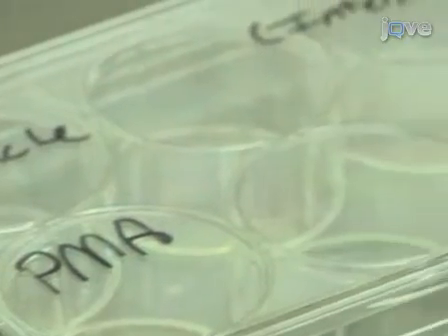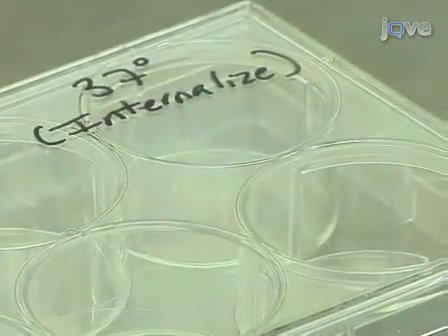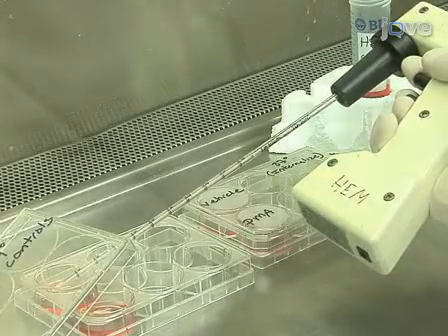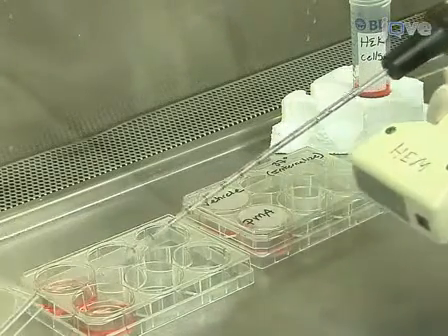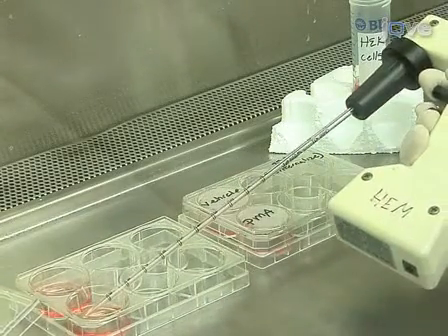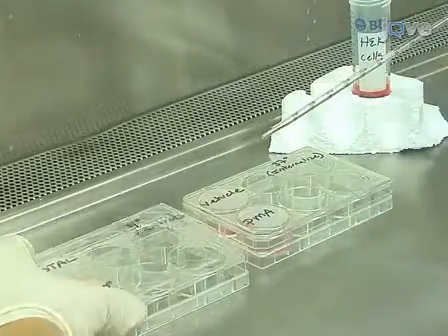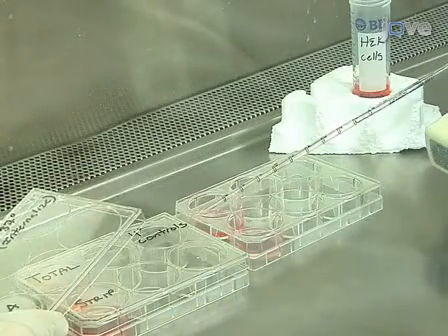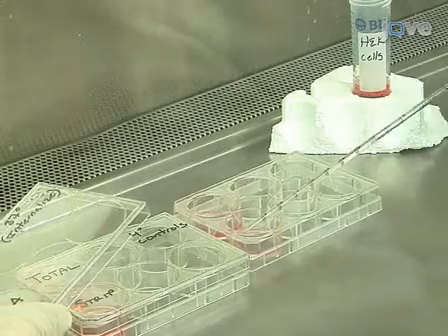Two wells on the control plate will be used for the total surface protein and stripping controls. Prepare a well on the experimental plate for each internalization condition being tested. Plate 1×10⁶ cells in 2 milliliters of cell culture medium such that the cells will be approximately 80% confluent by the following day.